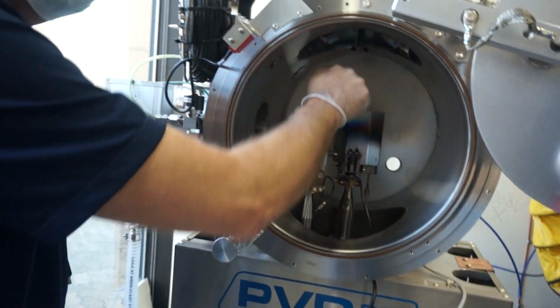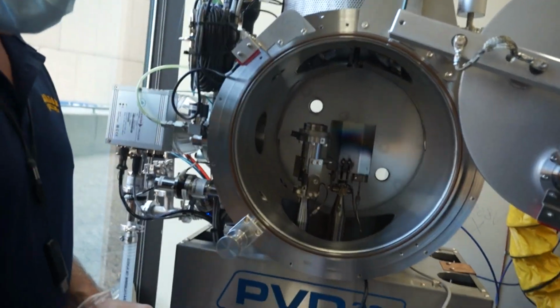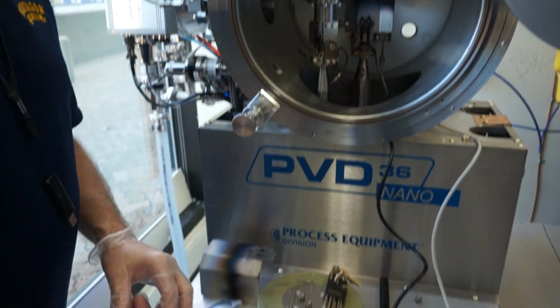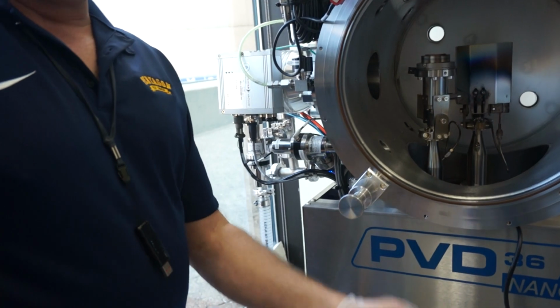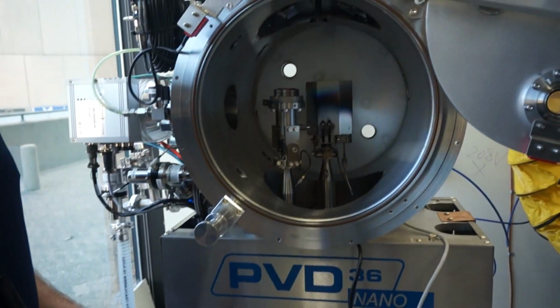Are those in some manual? Are those in the operational manual? Yes. Okay. So this was the target that you bought the other day. So, aluminum? Yep. What I did, and I like to do this because all targets look the same, I scribed the name on the back of it. AL. Good idea. Because it's like the shell game when you get them all mixed up, you don't know what material it is. So I would strongly suggest you do that.